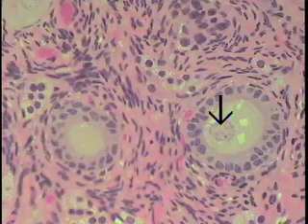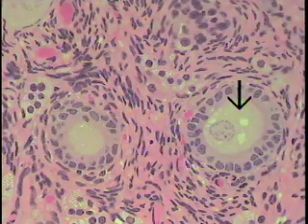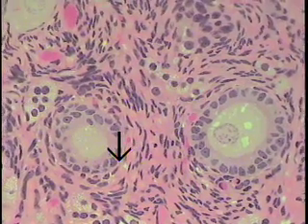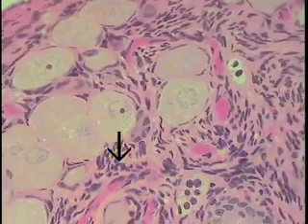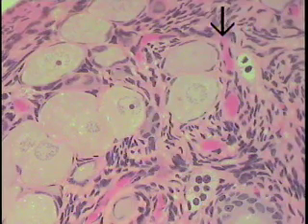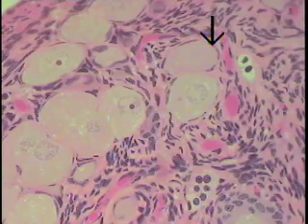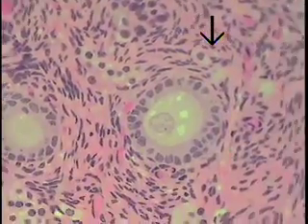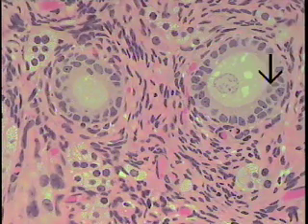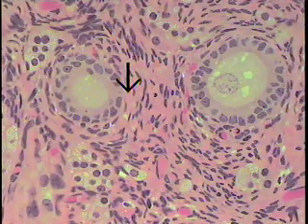Here we can see two other primary follicles — just growing follicles. You have your layer of follicular cells, the oocyte which shows the nuclear profile, and a section through the edge of another growing follicle classified as a primary follicle. Over here for comparison, one can see a whole field of primordial follicles where the follicular cells are thin, flattened, squame-like, and constitute a single layer. In the growing follicles, these follicular cells have become cuboidal, started proliferating, gotten taller, and will form a stratified layer surrounding the larger, more mature growing follicles.